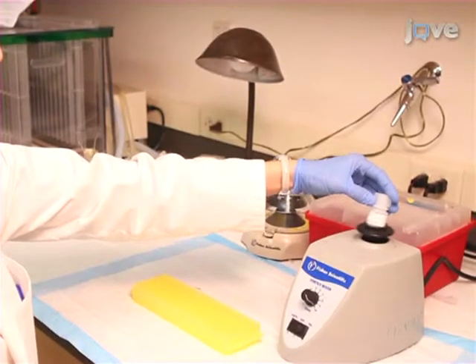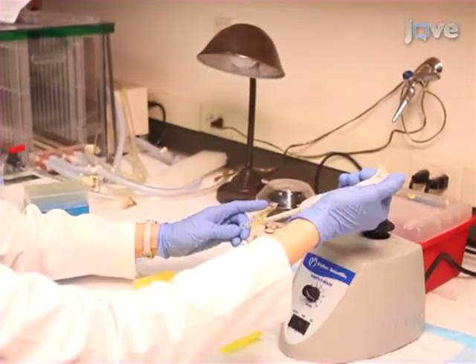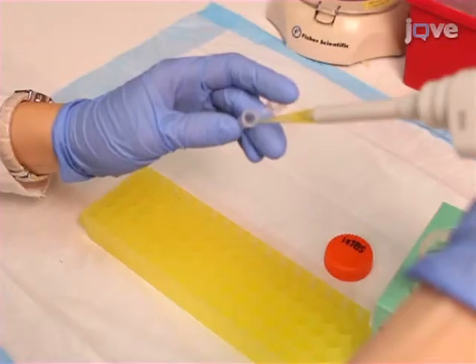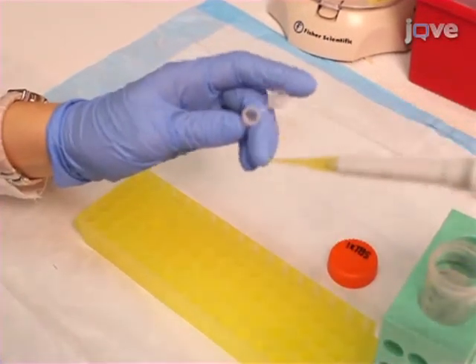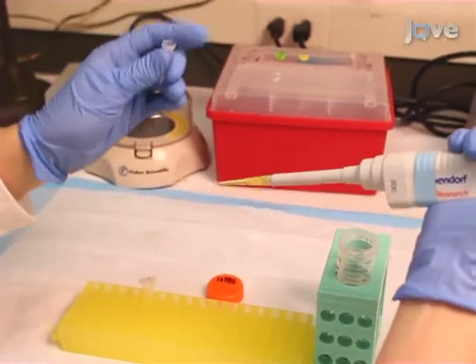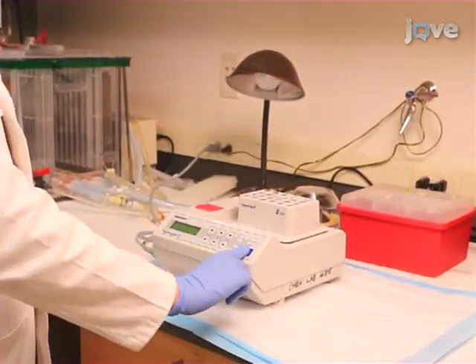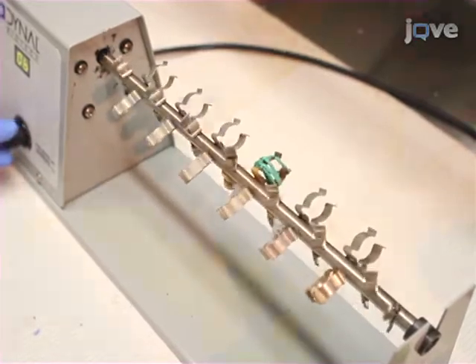In 0.5 ml tubes, prepare 50% slurry of anti-TMT resin in TBS at a concentration proportional to the intensity of the respective protein band. Wash the resin 3 times with 1 column volume of 1 times TBS. Proceed to add 200 microliters of TBS to each sample. Then transfer to anti-TMT resin and agitate at room temperature for 2 hours, followed by rocking overnight at 4 degrees Celsius.